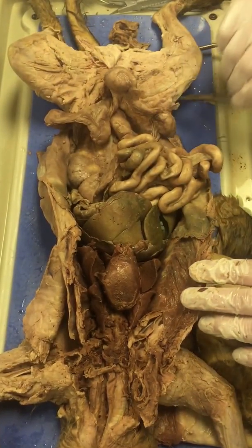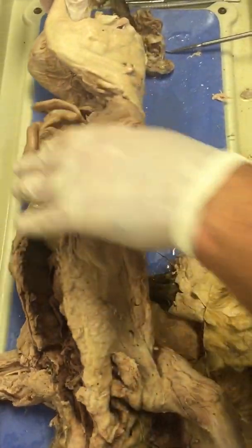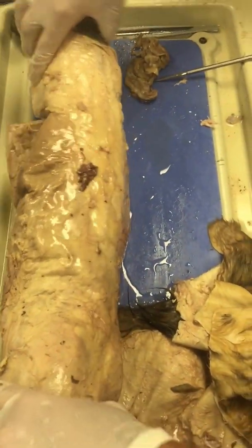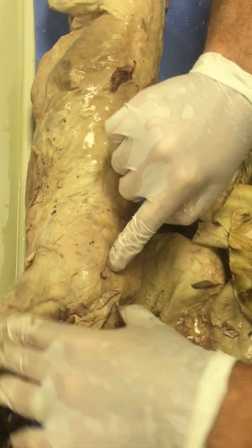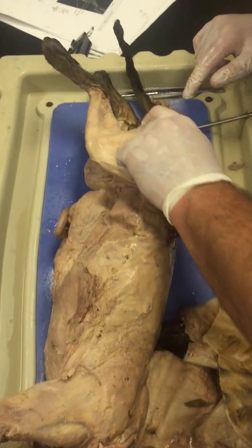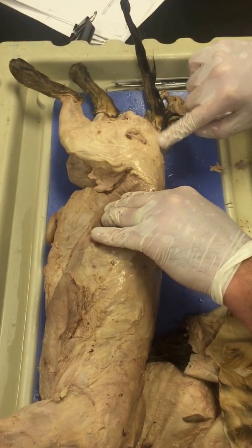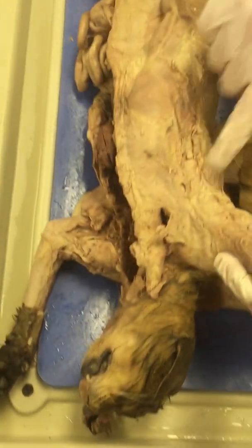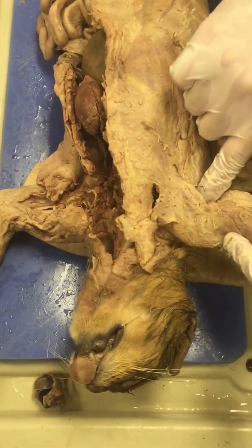If we were talking about nerves, you need to know that there are spinal nerves that come out from in between each of the vertebrae. Those are spinal nerves that extend off, and they innervate muscles. The large, big one that runs down the leg, let's see, I don't think they located it, but that's the sciatic nerve. It runs down basically the gluteus maximus, and it runs down the leg. And then there's a big axillary nerve that runs down each of the front legs or arms. It's up here in the armpit.